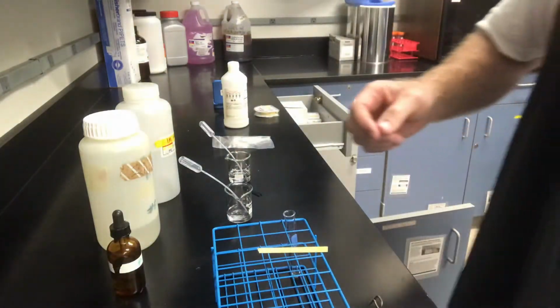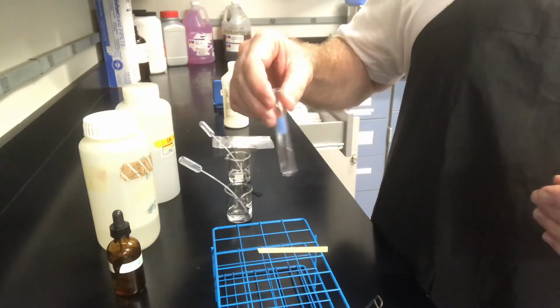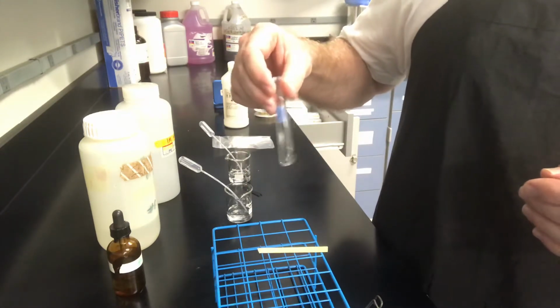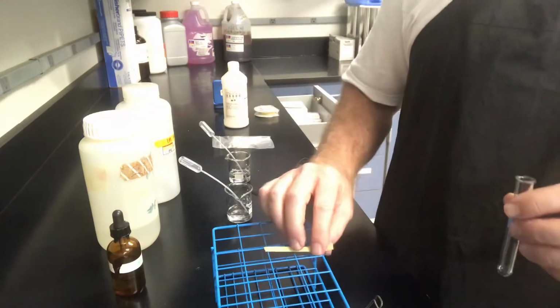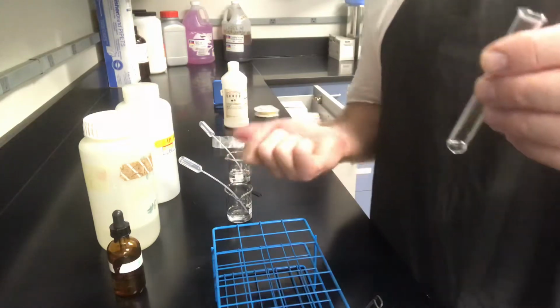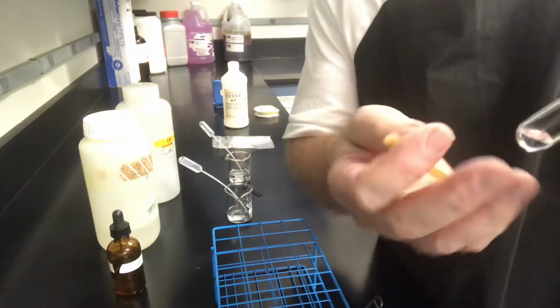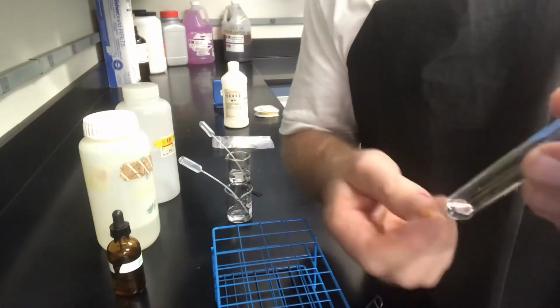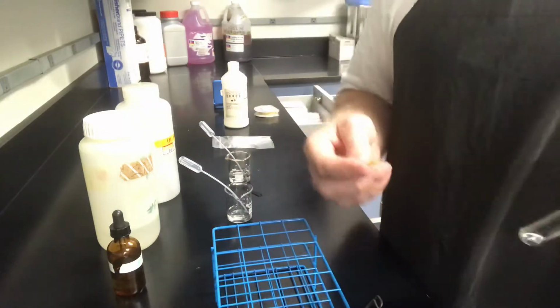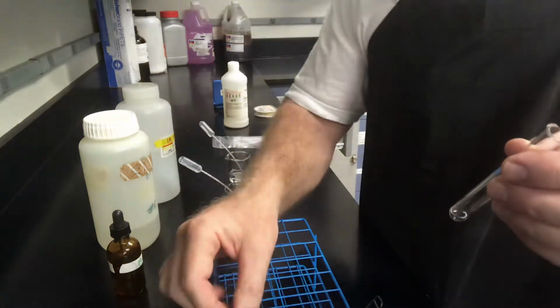Now it does call for me to take a pH reading at this point. I'm not going to do that. The reason is that there are so few drops in here, and they are very small drops from the pipette I used, that by doing that I'm going to absorb some of the solution, and I don't want to do that. I had this ready to go and decided against it. I'll do it at the end, but I'm not going to test the pH now.